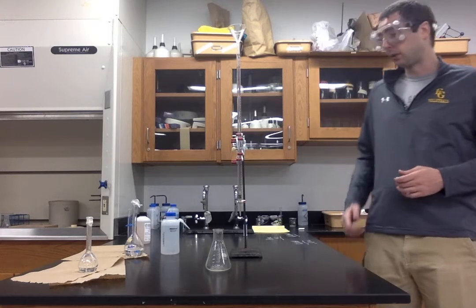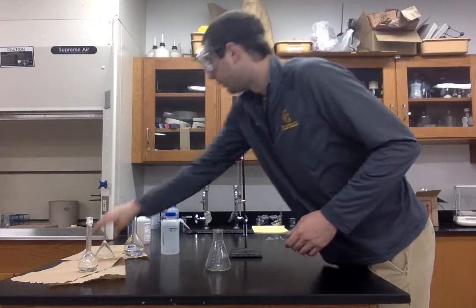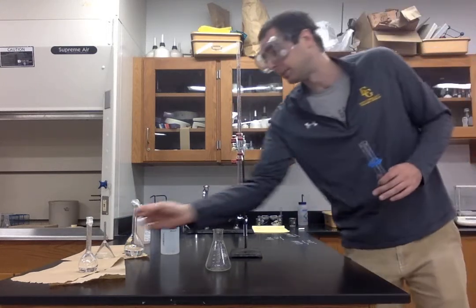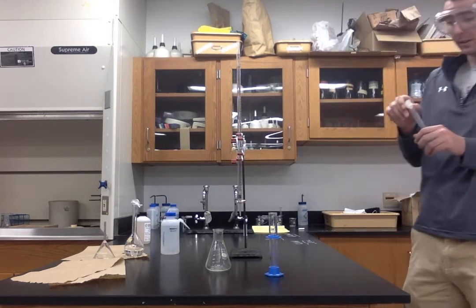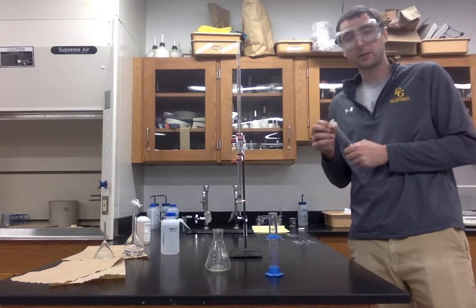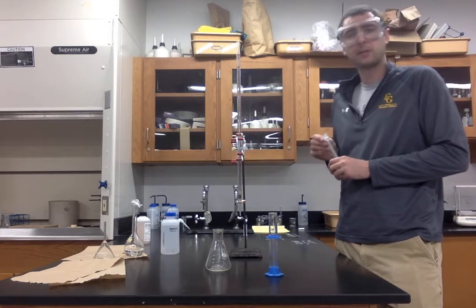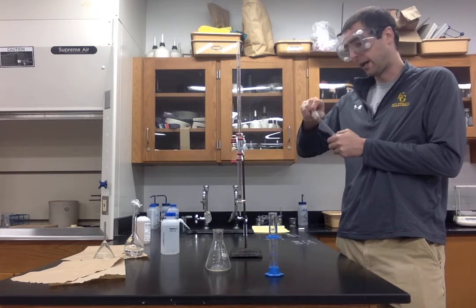Now let's take into account the volume. So to get the volume of our acid, I'm simply going to measure out a specific volume of acid. Now, I'm going to try to get this around 25 milliliters, but if we are a little bit more or a little bit less, that is okay. We just have to write down the overall initial volume.